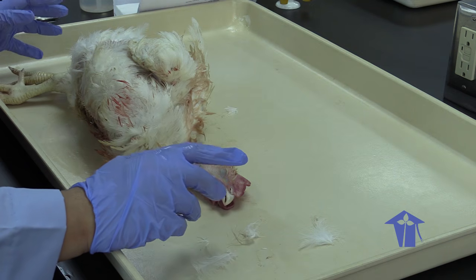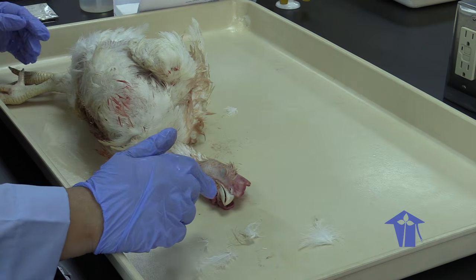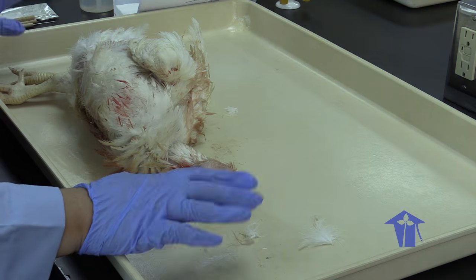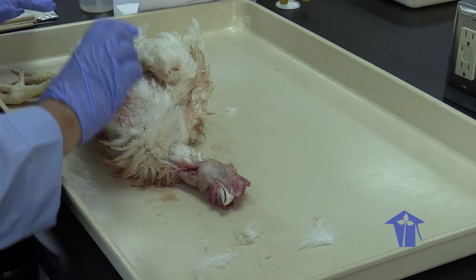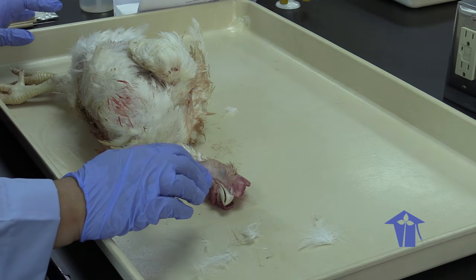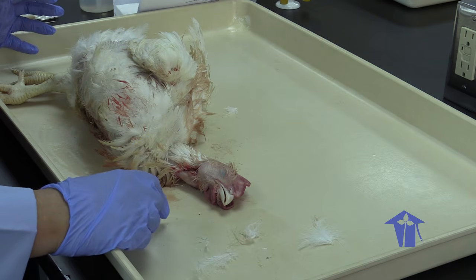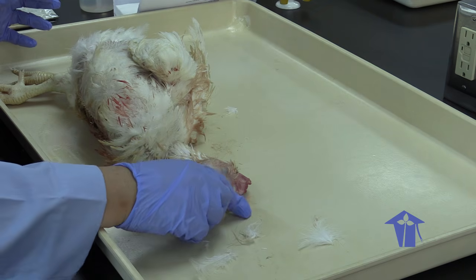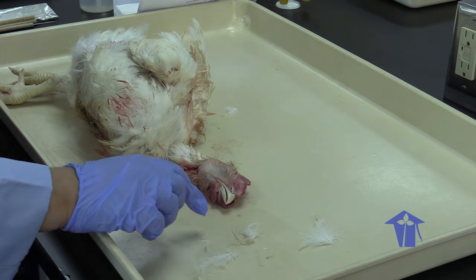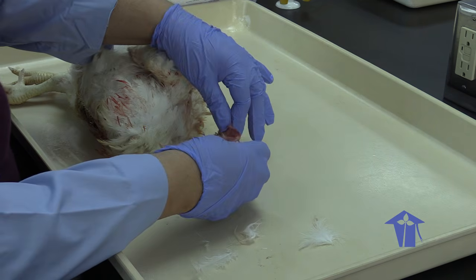So certain things that we would probably see in the common fowl in your yard, or the layers that your family will sometimes cook in a curry stew with some dal and rice as a special treat, the meat here is always very soft. It's a lot of white meat, and you generally don't see the reproductive organs well developed. But today we're focusing on the digestive system and on the parts of this chicken that are necessary for processing food.